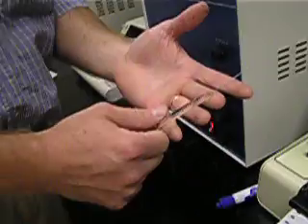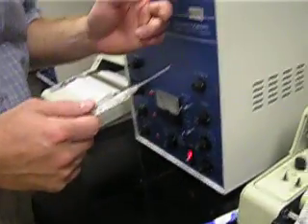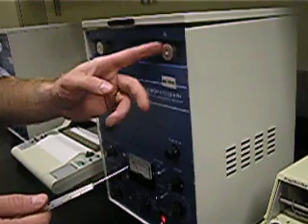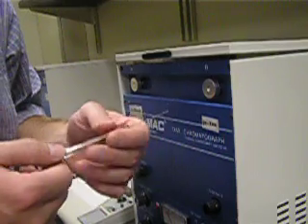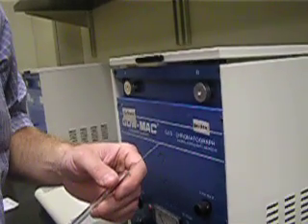Always make sure you draw up sample and check for that. These columns are going to be hot, so please keep your fingers off the cover. Make sure when you guide the needle in, you hold the needle, and once you're in, inject as quickly as possible.